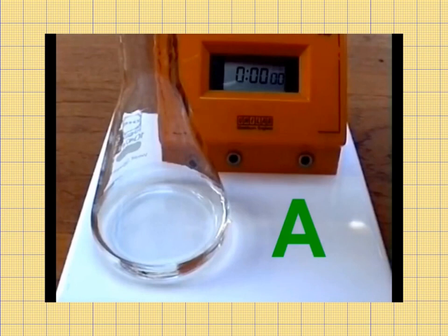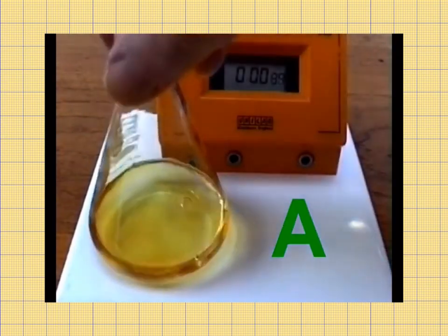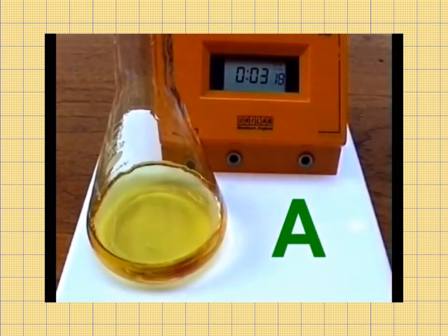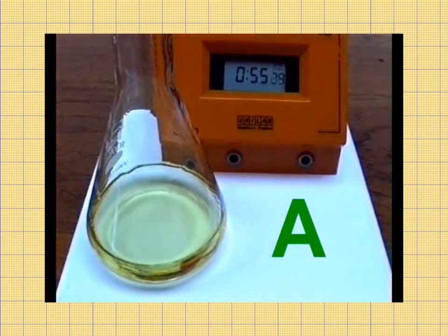One method might simply be to mix the iodine and propanone together and record the time taken for the mixture to become colourless. Reactants were mixed together and the stop clock started simultaneously. In the following 4 sequences, the video has been speeded up by 6 times to make the changes easier to see. Try to estimate in each case to the nearest 10 seconds when the colour of the iodine just disappears.